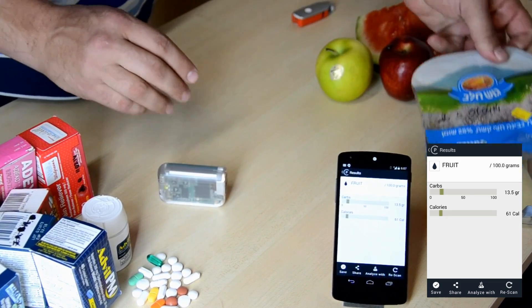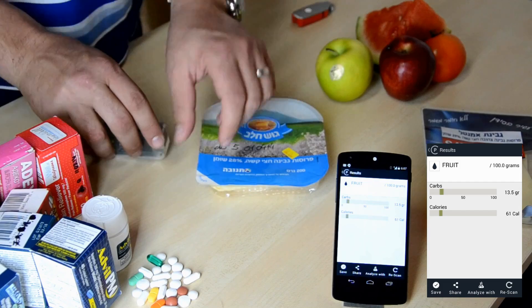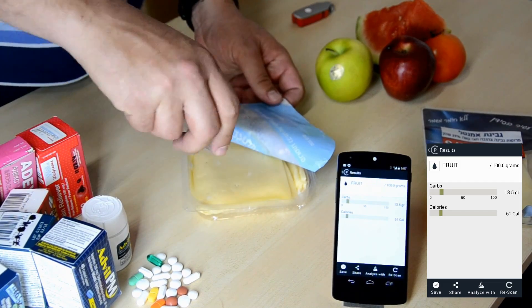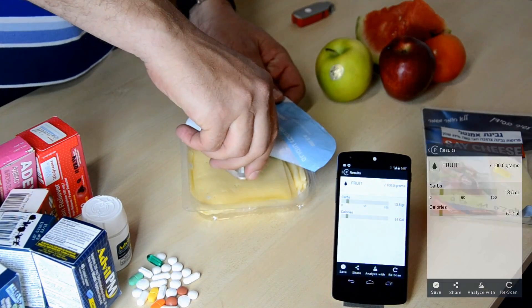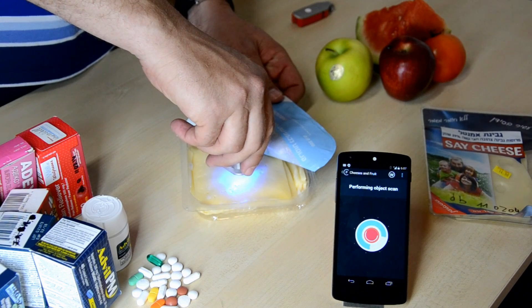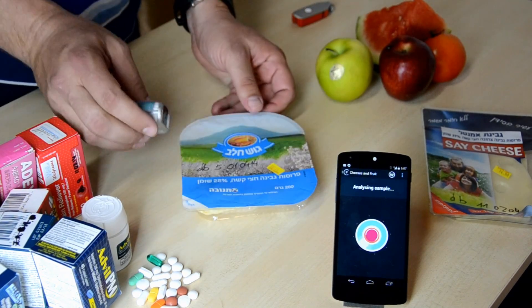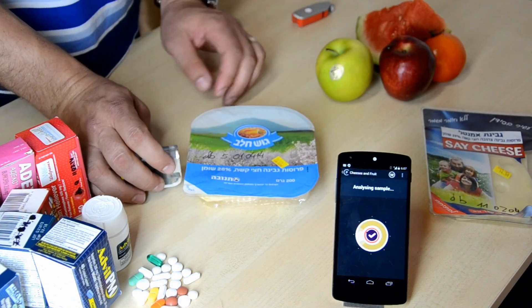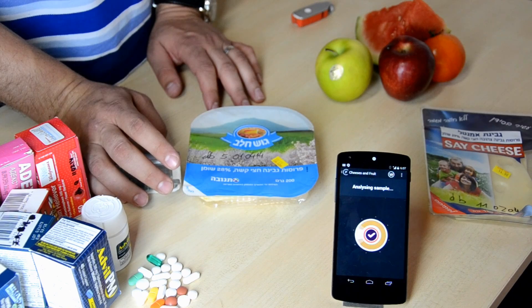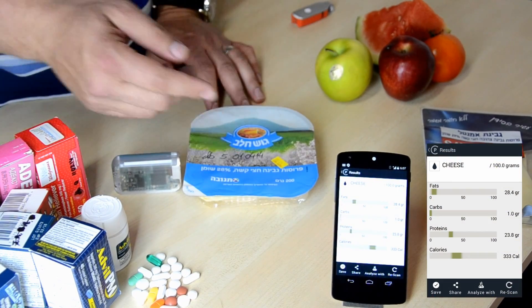Next, we'll measure a cheese. This is a cheese we bought at the supermarket. I take the device, shine light for about two seconds, then wait a few more seconds and I'll get the response on our cell phone.